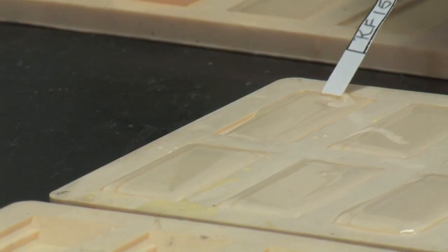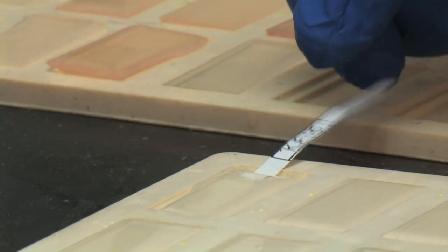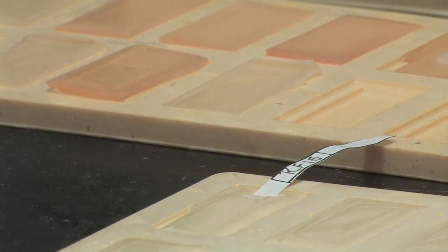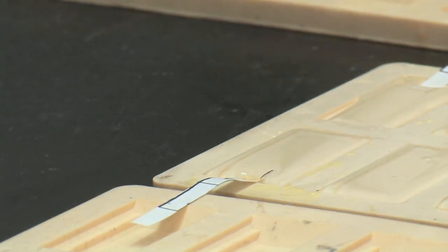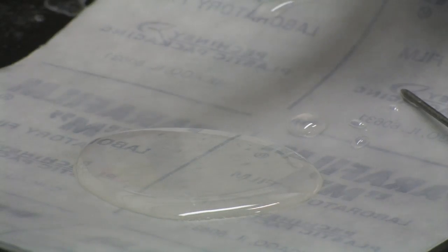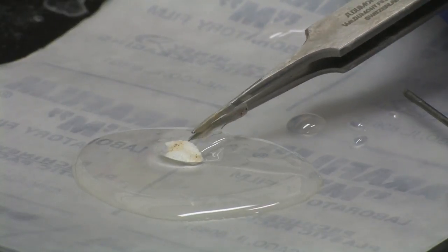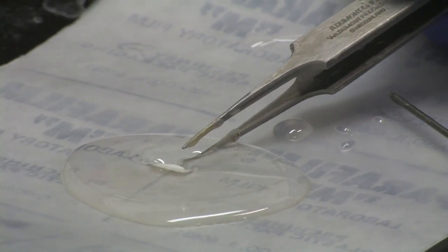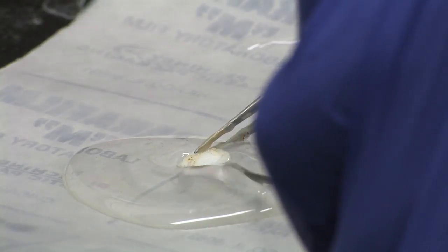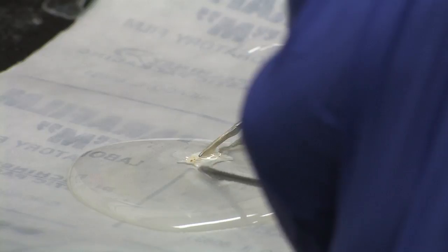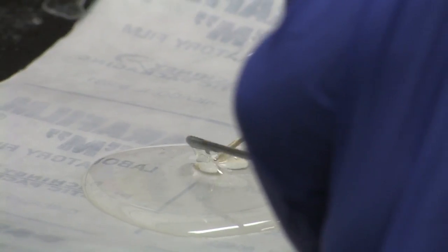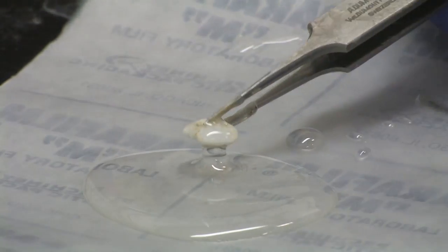Place the label for each otolith in the side of the well. Dip the otolith into the epoxy on the parafilm and use a probe to push epoxy into the sulcus. Dipping the otolith into the epoxy before putting it in the well is intended largely to avoid getting air bubbles in the sulcus groove. You don't want any air bubbles in, around, or near the sulcus of the otolith.